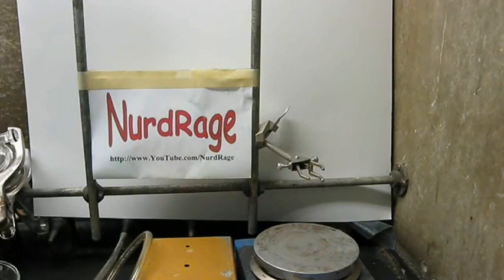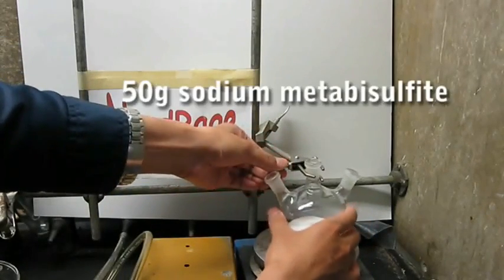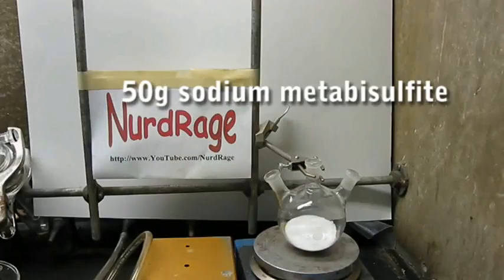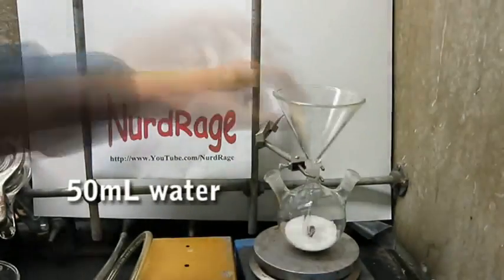Sulfuric acid is an extremely useful acid, and there are many methods of making it. We'll be showing one method here. First, we need to make a sulfur dioxide generator. In this case, get a 3-necked flask and fill it with 50 grams of sodium metabisulfite. Then, add in a stir bar and 50 milliliters of water.